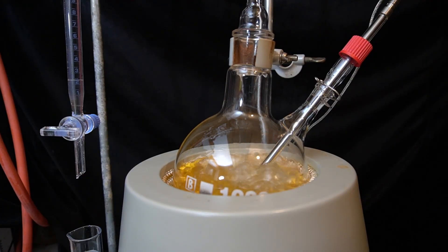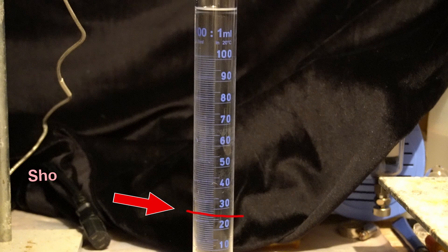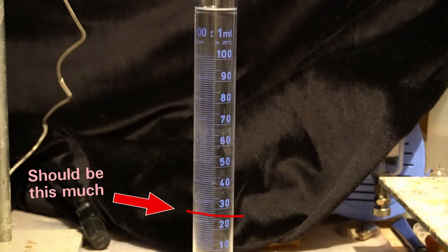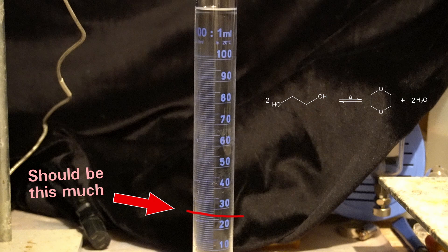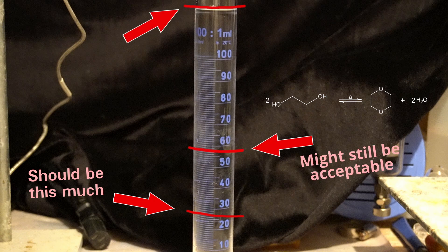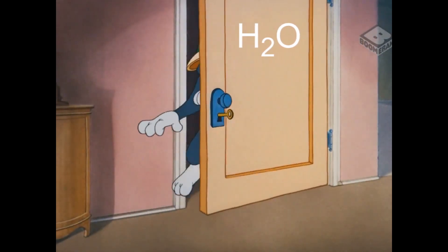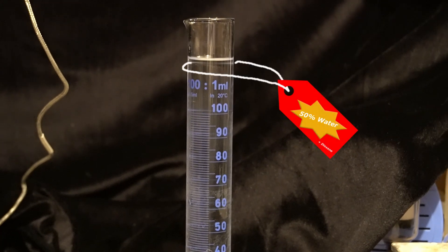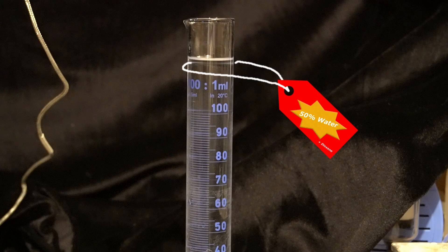I am back, and this has now been refluxing for 16 hours. The water level has remained constant for the past hour, so we are done with this step. The mixture has turned a vibrant yellow color, and in total I collected 120 milliliters of water. That is a bit weird, because it should only be about 27 milliliters based on the amount of cyclopentanone I used. And even if the unreacted ethylene glycol forms dioxane as a side product — which also releases water — the total amount should only be 58 milliliters. The only explanation I could come up with is that dioxane also collects in the water layer since it's miscible, and artificially increases the volume — because then it comes out to around 120 milliliters. And that's probably what happened. But let's not worry about that and just move on.